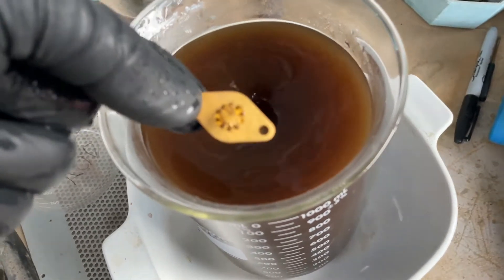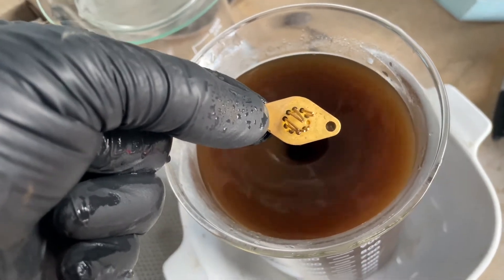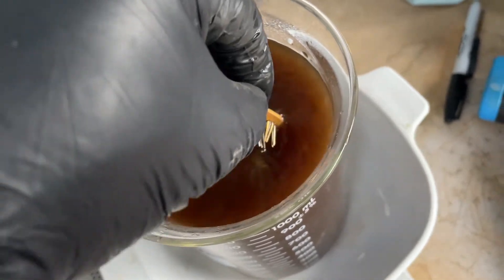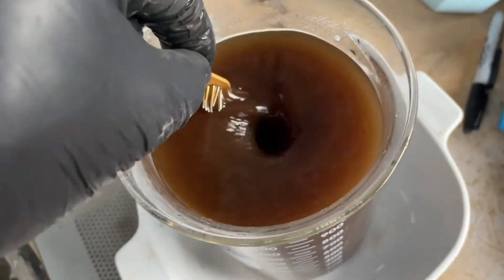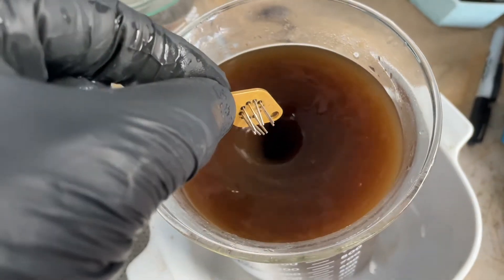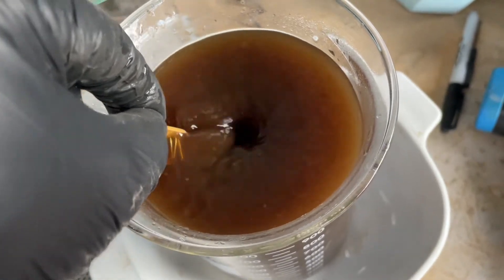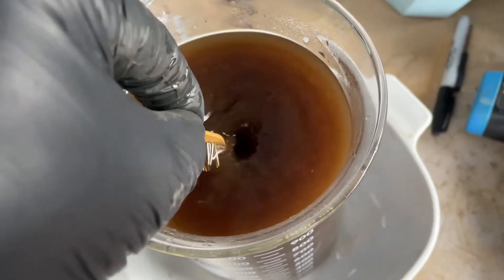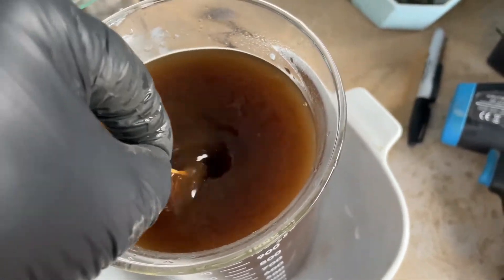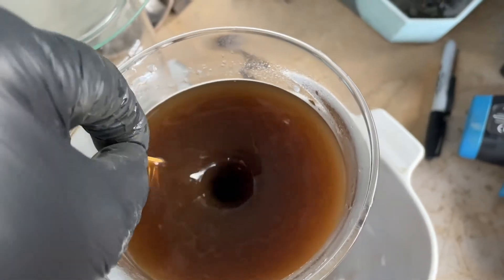Okay, there's about 10 seconds. A little bit coming off. Let's go a little more. Oh yeah, look at the legs — the legs are coming right off. Look at that, they're getting a lot less goldy. Oh look at that, the coating on the bottom is a lot thicker apparently. That's pretty sweet.